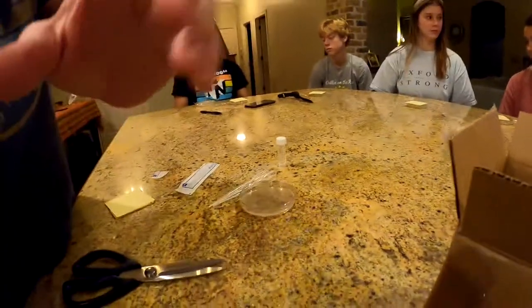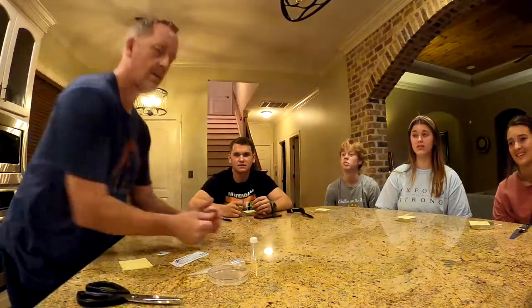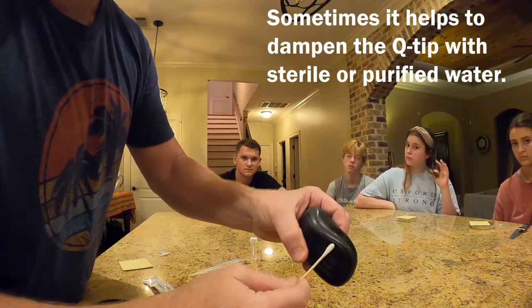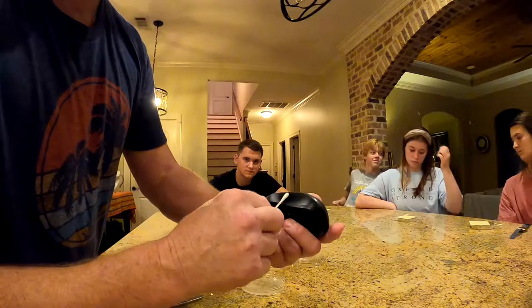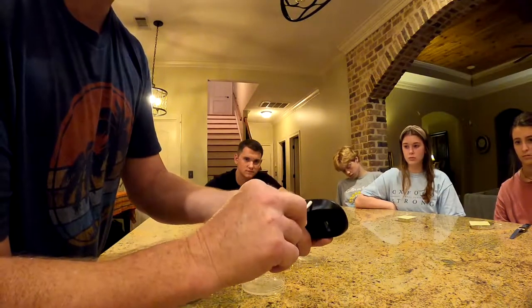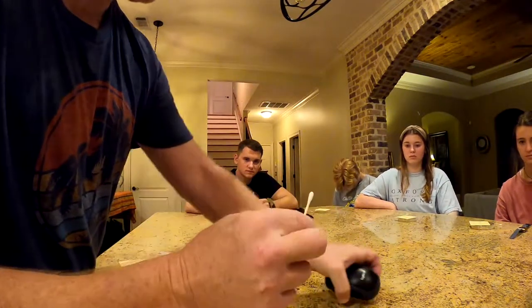The volunteers ask the instructor to swab his computer mouse. He makes the point: you can't see anything on the surface, but there's definitely bacteria — probably staph, maybe strep. Bacteria is everywhere on any surface, and no matter how many times you use Clorox wipes or Lysol, there's still going to be bacteria on it.